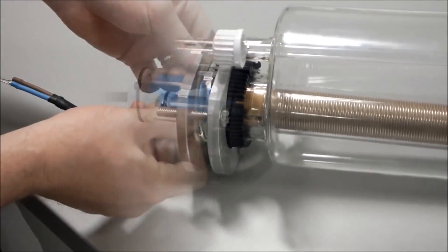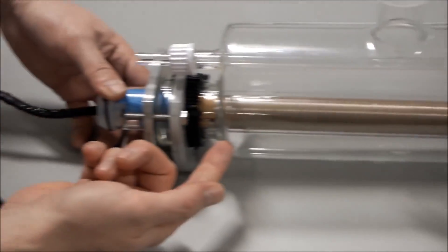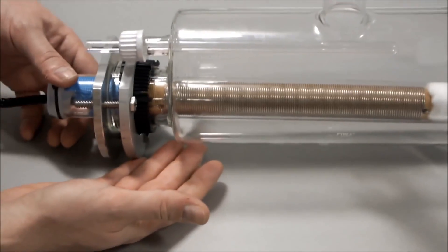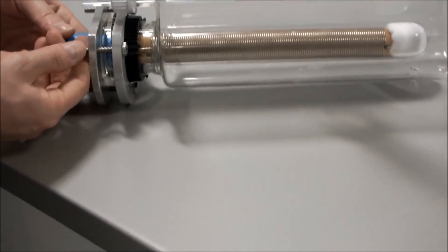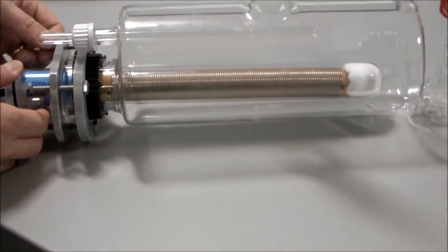When tightening the screws, ensure that the heater itself is perfectly horizontal — not touching the end of the boiler and not touching the bottom of the boiler. When the bolts are tightened up fully, it will pull the heater level.